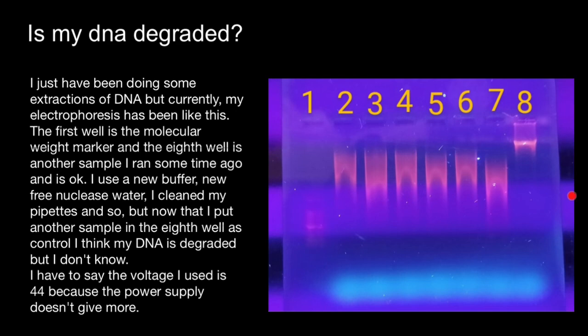And today we are going to discuss this gel, and here's a problem statement. I just have been doing some extractions of DNA, but currently my electrophoresis has been like this. The first well is a molecular weight marker, and the eighth well is another sample I ran some time ago, and it's okay. I use a new buffer, new nuclease-free water, and cleaned my pipettes and so on.